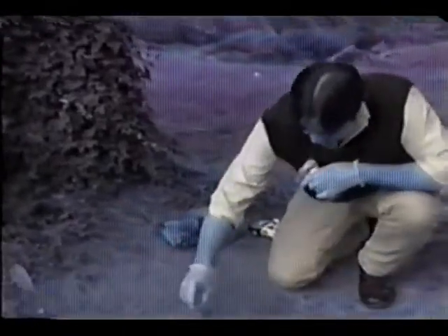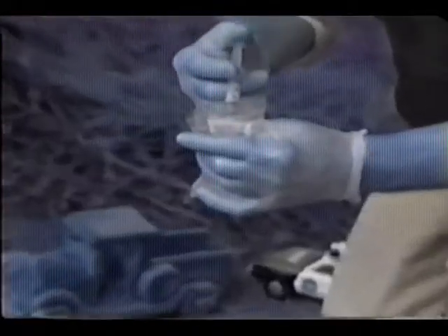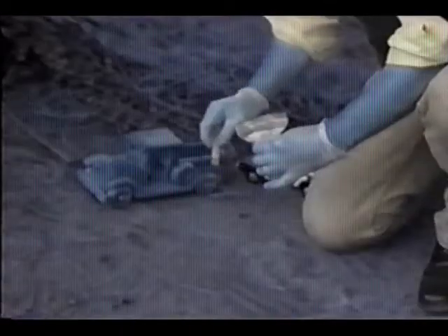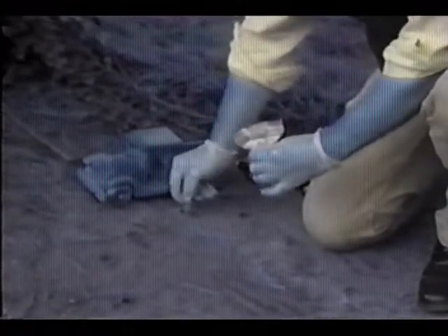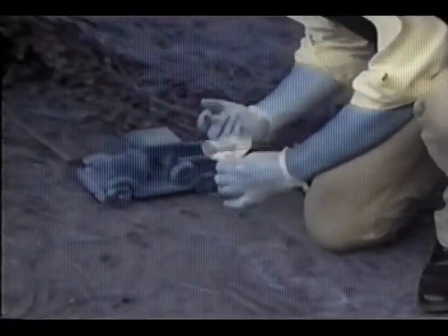After the perimeter sites are identified, find the children's principal play area. Here, you will collect between 3 and 10 subsamples of soil along an X-shaped grid. Again, look for areas where the soil is bare. Allow about 2 feet between each subsample. As you identify and mark the sites, record them on the property sketch.